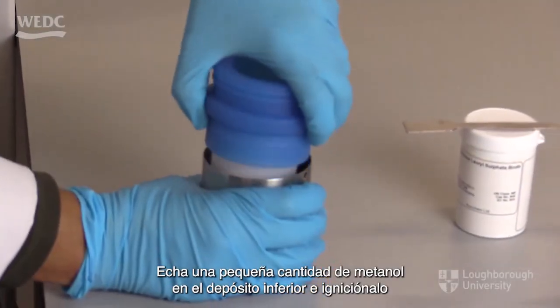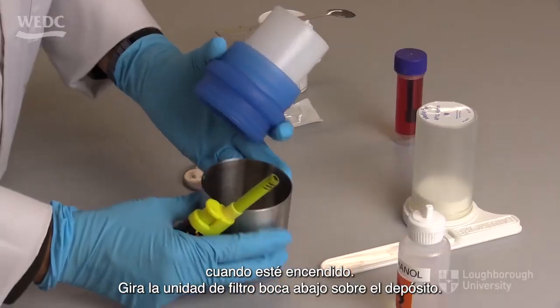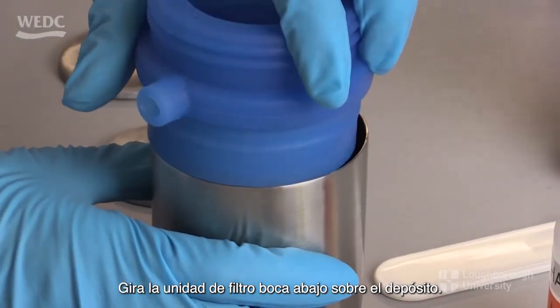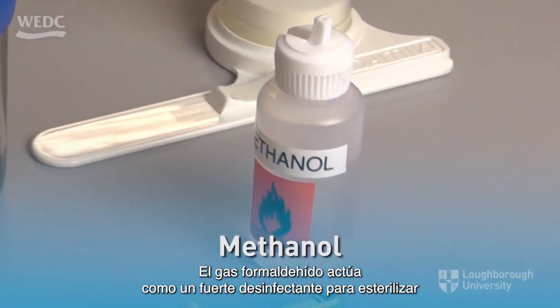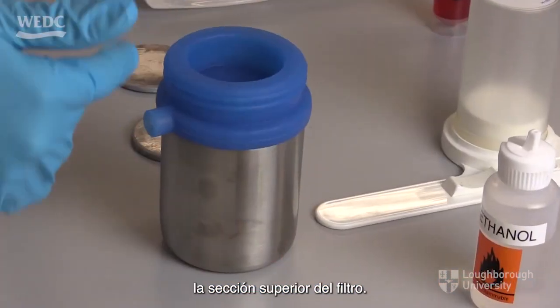To sterilize the filtration unit, squirt a small amount of methanol into the bottom reservoir and ignite it. When alight, turn the filter unit upside down over the reservoir. Methanol is used because formaldehyde gas is released when burned without oxygen. Formaldehyde gas acts as a strong disinfectant to sterilize the top section of the filter.